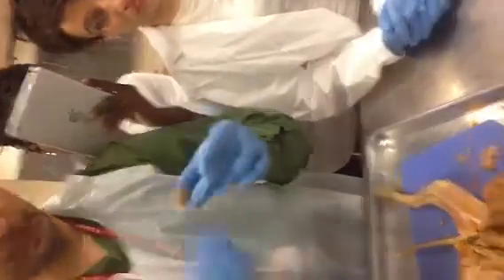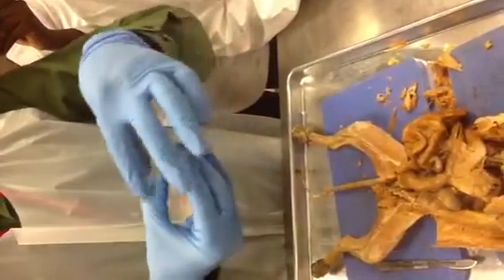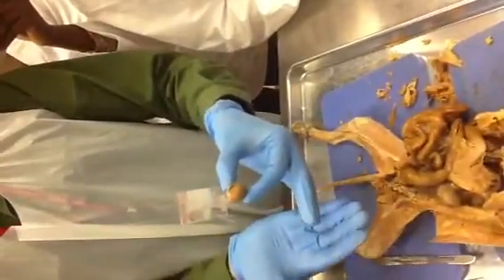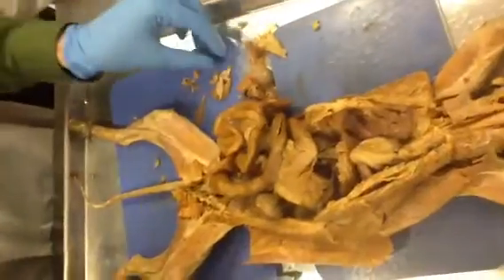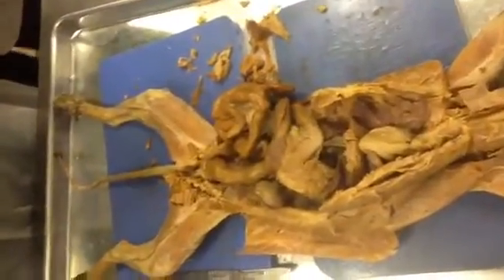And here you go. This is the fibrous capsule, which covers the kidney. Okay. And so I want you guys to expose one of the kidneys, pull off the fibrous capsule on one of your kidneys, and the other one, cut it mid-sagittal, and expose and look at the inner layers. That skin is the fibrous capsule, the one I peeled off. This is the fibrous capsule, covers the kidneys.